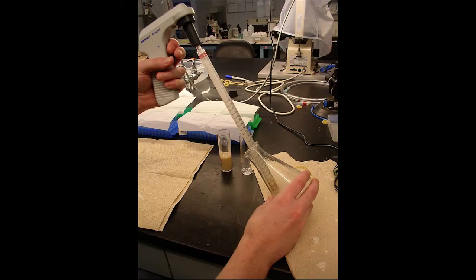Second, never fill the pipette up all the way or the liquid will get into the device and keep it from working properly.